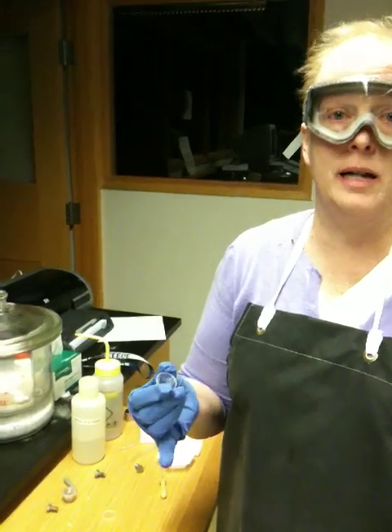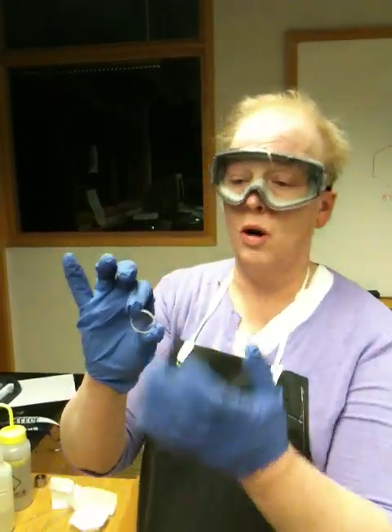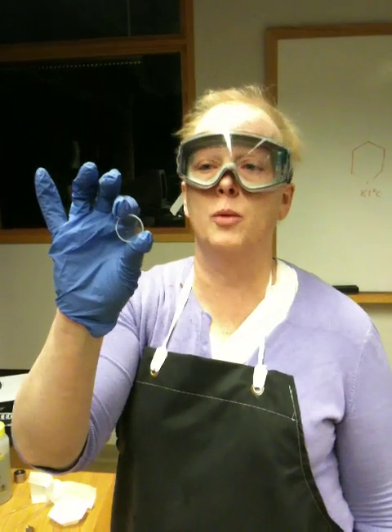These are sodium chloride discs — they're made out of sodium chloride pressed at very high pressure. If you take very dry sodium chloride and press it at high pressure, you get a window that almost looks like glass. What happens to them over time is they get etched a little bit. The problem is they're water soluble, as you would expect sodium chloride to be. So realize you can never wash an NaCl plate with water — you have to wash them with organic solvent. As samples are put on that have little bits of water in them, or compounds that dissolve the salt a little bit, the salt gets etched. That's okay; they still work. We use sodium chloride because it is invisible to the infrared spectrum — it doesn't absorb infrared wavelengths.